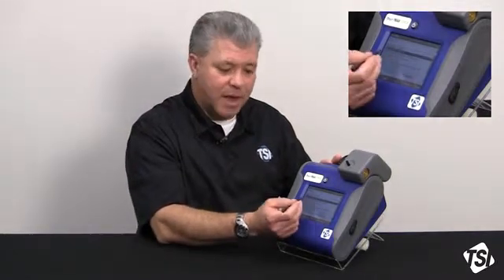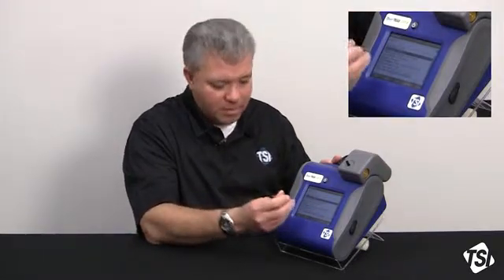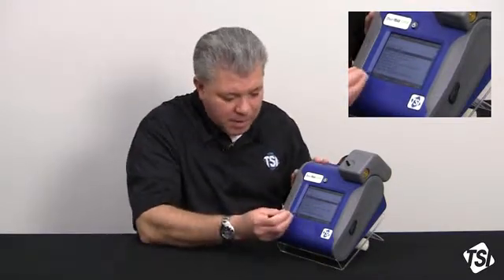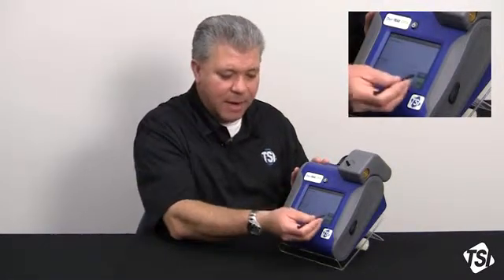And now I can go back through the rest of the program log mode and set up my test length. I can reset, if I need to, my log interval, but again, that's no less than 2 minutes. It could be 2 minutes, it could be as great as 1 hour. And I can set all my other parameters. How many samples do I want to take? Do I want it to be a continuous run? So on and so forth. Once I get all of this programmed, I simply hit main, go back to the main screen, and I'm ready to start sampling. So that, in a nutshell, is how to use the AutoZero module.